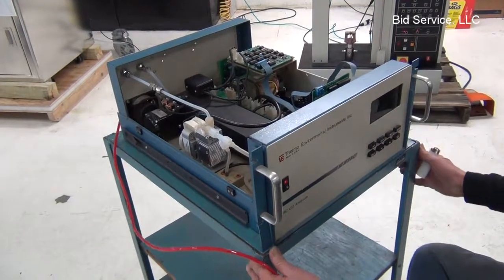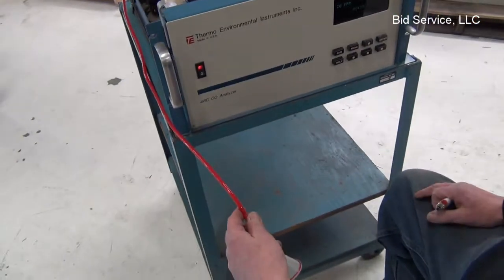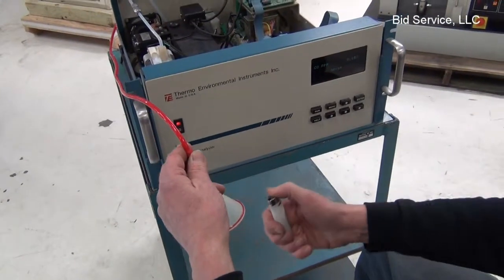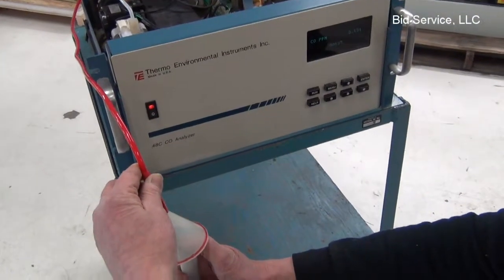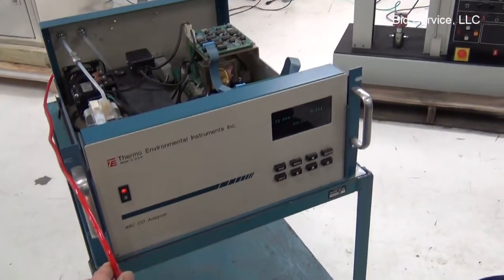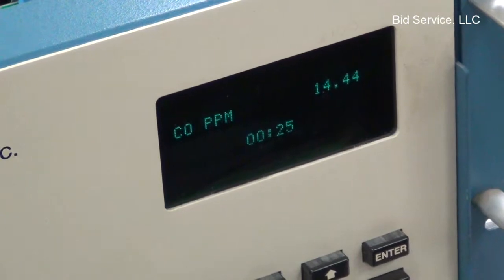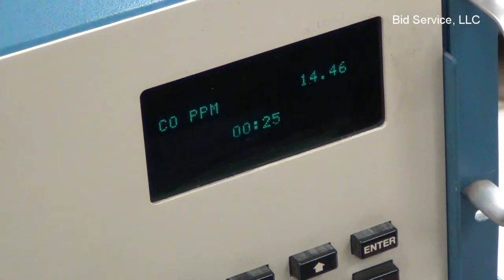To illustrate the sensitivity of the instrument — when you burn anything, it creates carbon monoxide, and that includes butane gas. So I'm just going to take a standard butane lighter and allow it to sense butane for about five seconds. And immediately, the analyzer has the ability to count very accurately the amount of carbon monoxide that it detects.